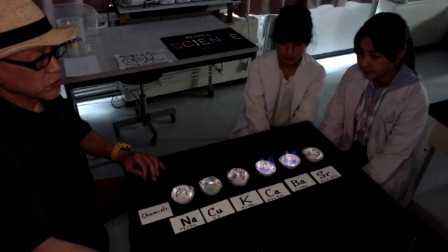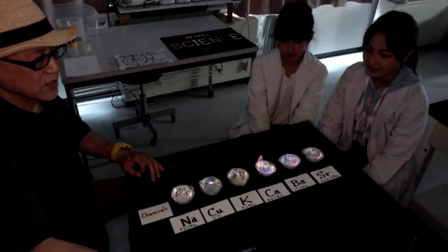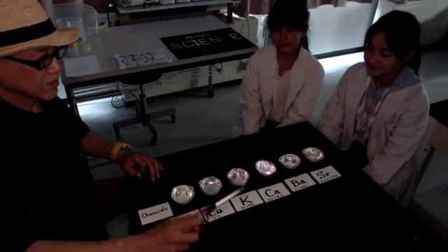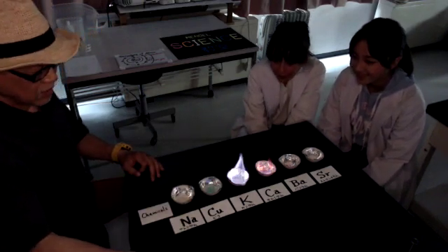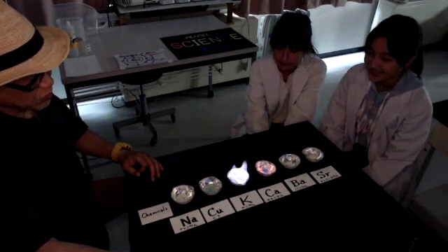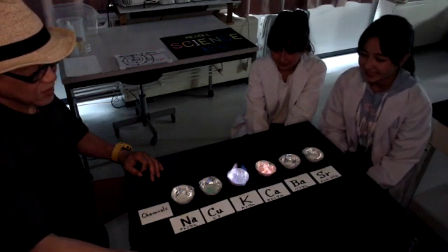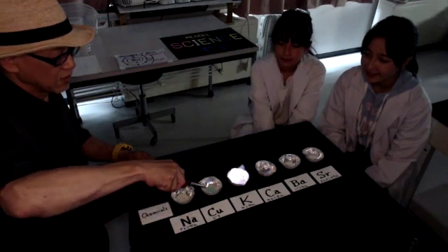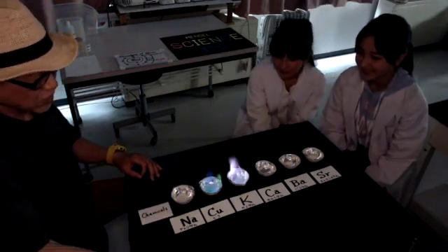The barium started to release yellow color light now. And potassium — bright purple color light can be observed. Beautiful. Copper releases the emerald green color light.